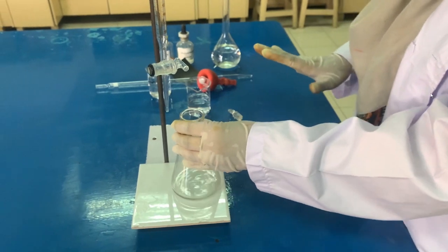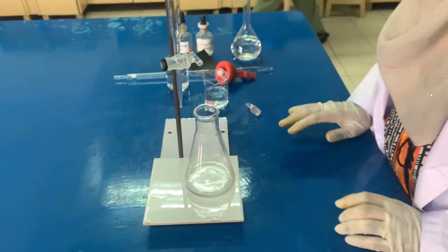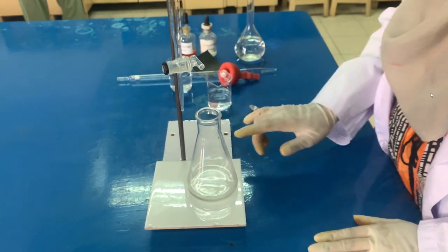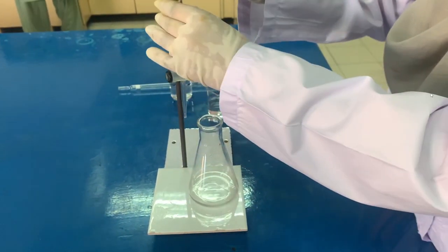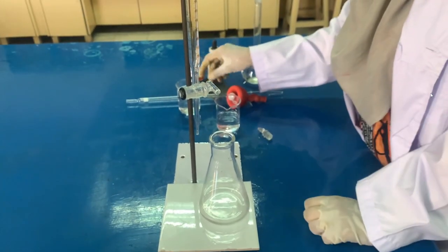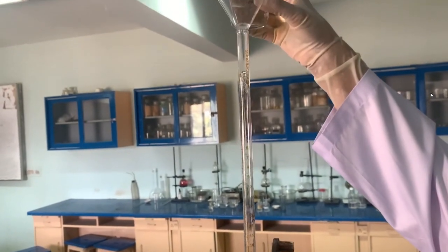Now it depends on us which indicator we are using. The colour of phenolphthalein in sodium hydroxide is pink. Now we will run hydrochloric acid and then we will add the indicator. We will run the hydrochloric acid.